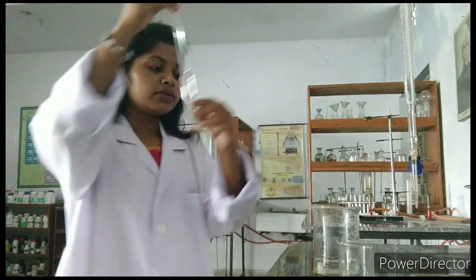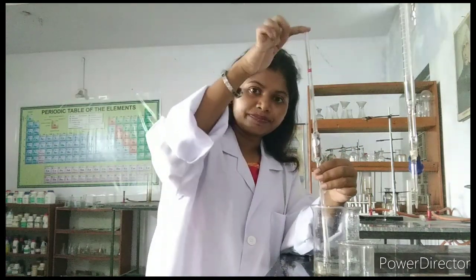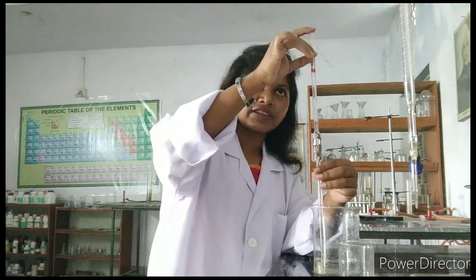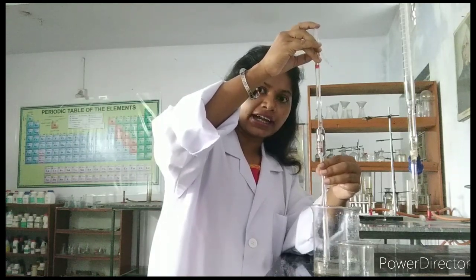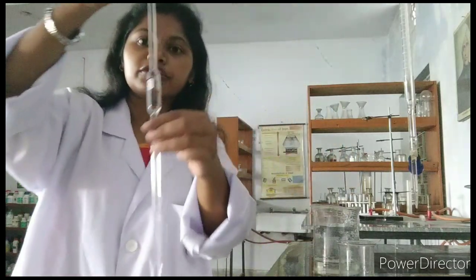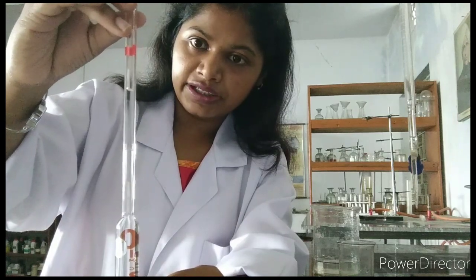What I will do — the rest of the water will go back into the beaker. You have to slowly loosen your finger grip, the index finger slowly. Just slowly remove it and you will see that the water is falling down. Can you see here — like this, you can see the water is going down.